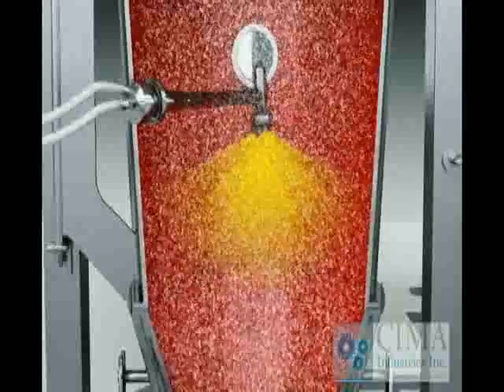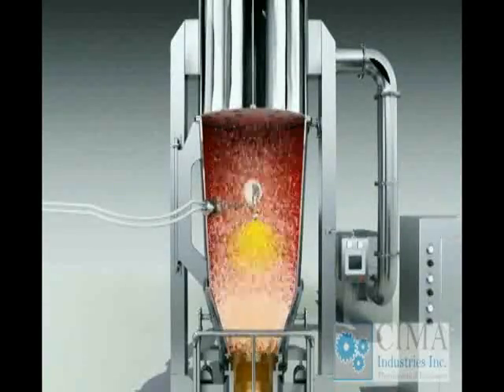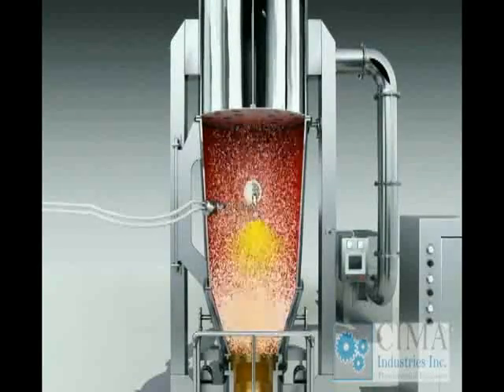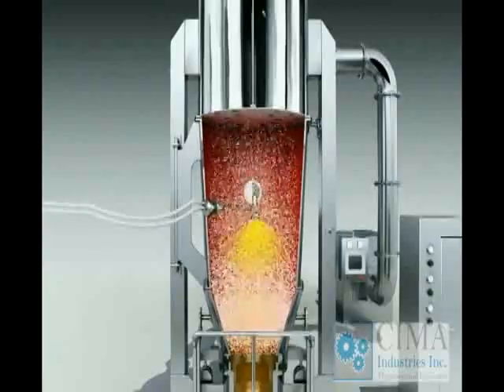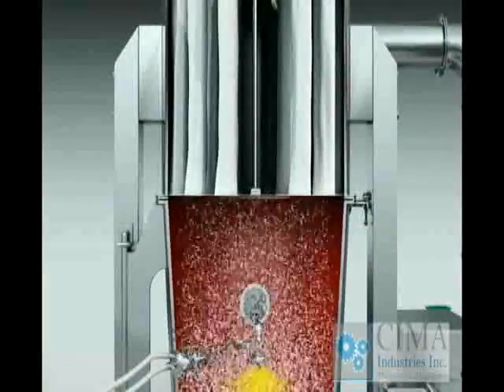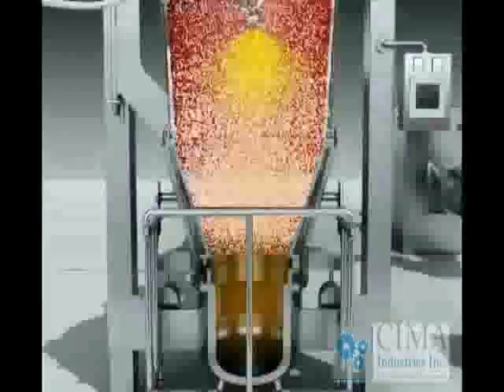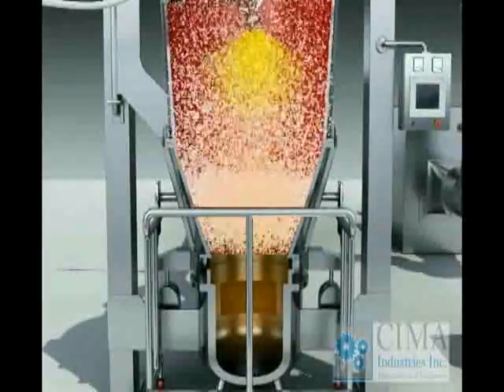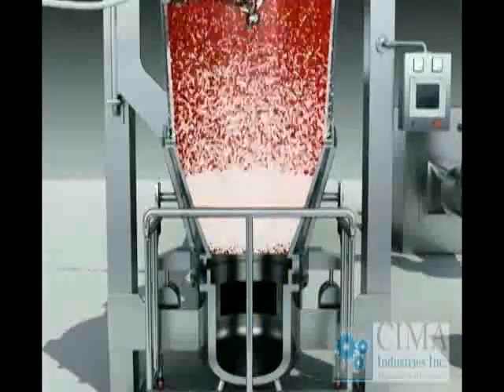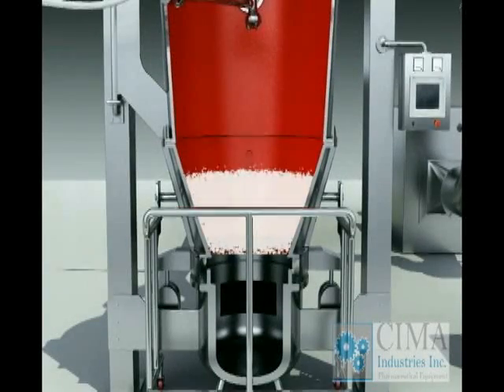The powder should be accumulated together and form granules. The powder material becomes bigger and is forced back to the fluid bed when the airspeed lowers down in the expansion chamber. The very fine powder goes up into the powder collecting chamber and is captured by the filter cloth bags. Pneumatic shaking arrangements shake the filter cloth bags so the powder drops down to the fluid bed. The process circulates during the granulation process to make the desired granules, normally around 20 to 80 mesh.